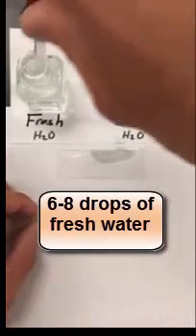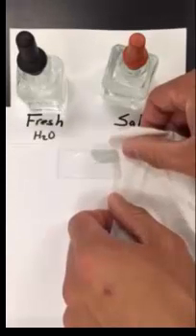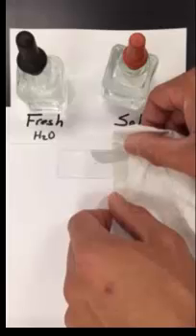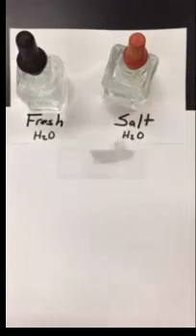All you're going to do is add a few drops there and then you're going to take your piece of paper towel and draw the water across again. So what's going to happen now is your fresh water is now going to flood your red onion skin and replace the salt water that you had placed there before. And you're going to keep doing that until most of this water, the fresh water on the left of the cover slip, is going to move under the cover slip and now you're ready to finish up your lab.